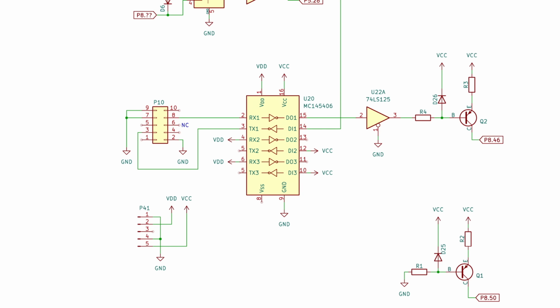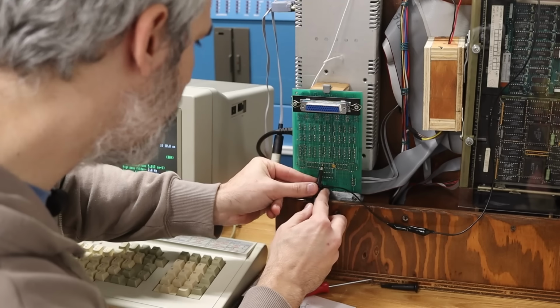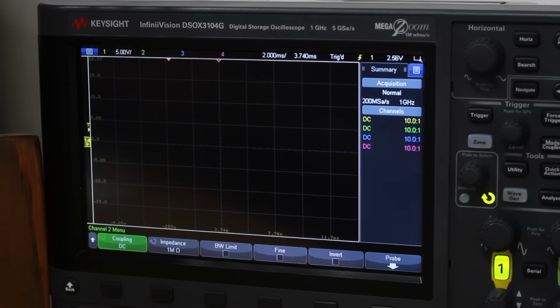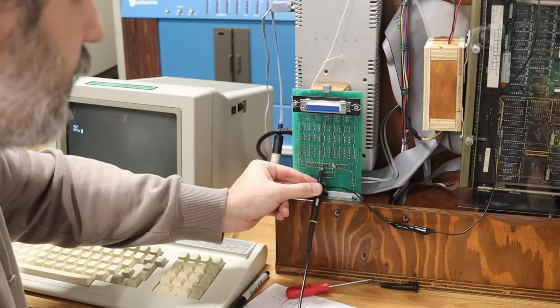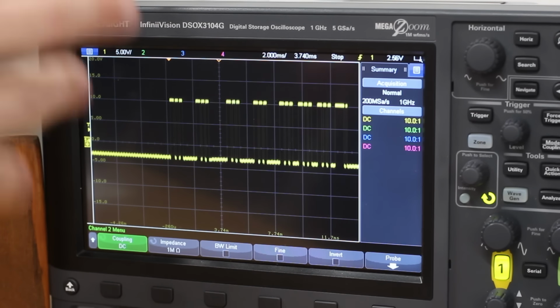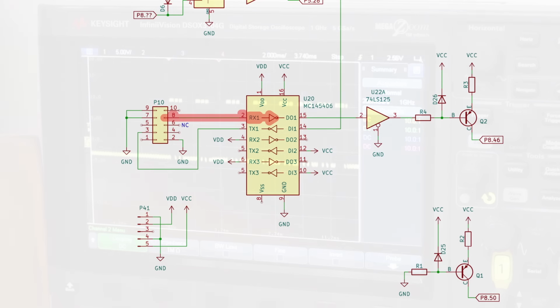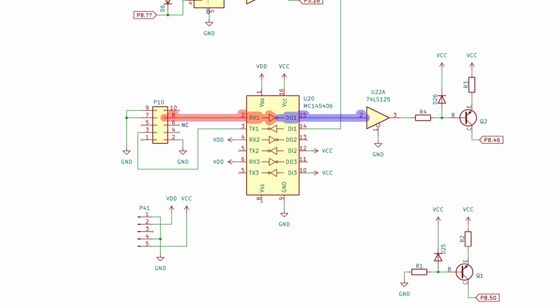The signal is coming into pin 2, so if I put my probe on pin 2 right here, you can see that we're sitting down at around about -4 volts. So I'll go ahead and hit single shot on that. We'll run a phase, and yeah, you can see a flurry of RS-232 data coming into this IC. Goes from about -4 up to about 10 volts. And then the output on that IC is on pin 15.